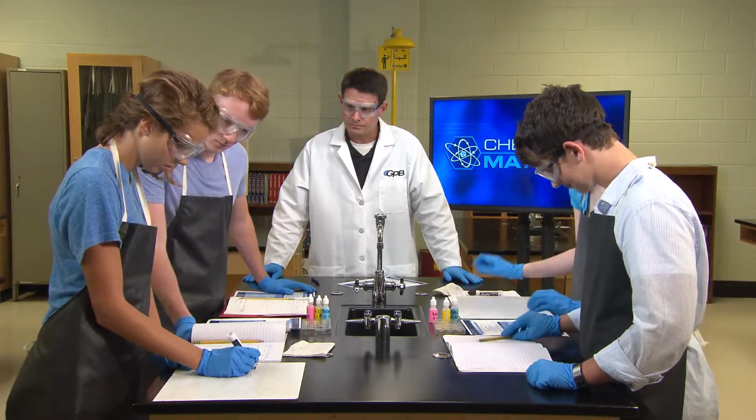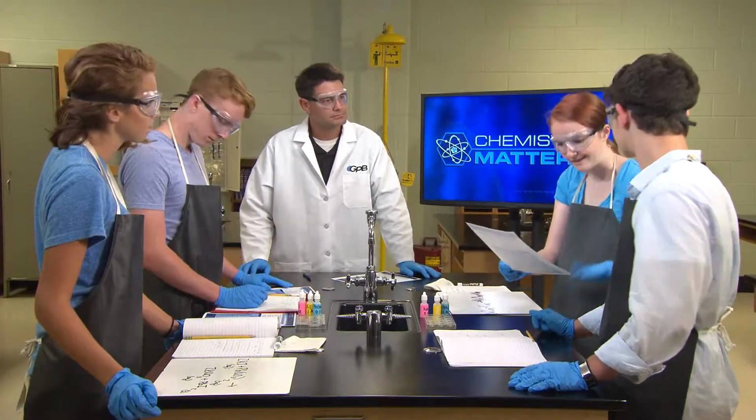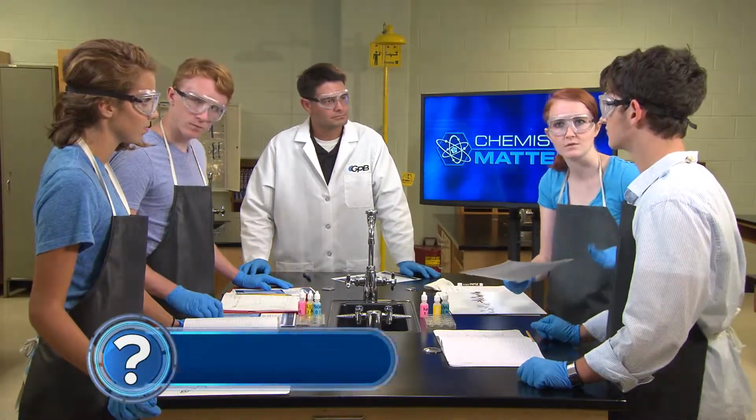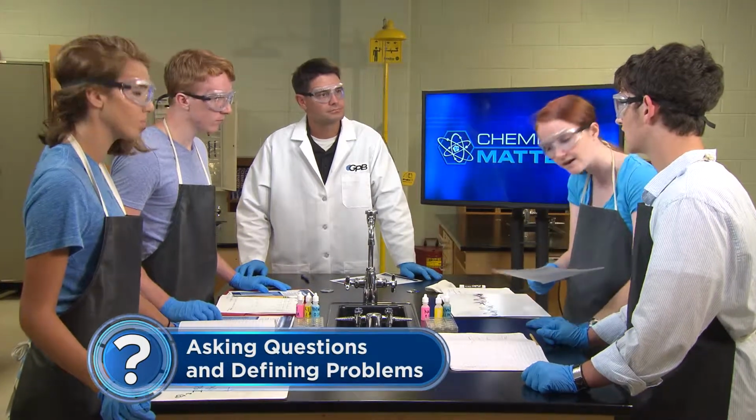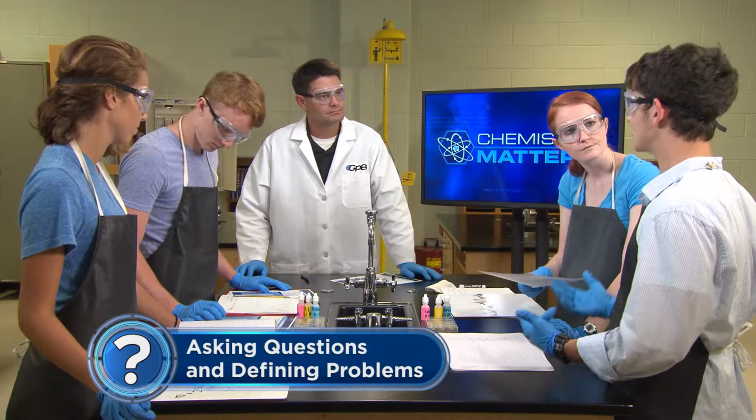Okay, so potassium nitrate is soluble, and lead-2 iodide isn't. So is that what the yellow stuff was? The lead-2 iodide? I believe so. Let's look up the products of one of the mixtures that didn't react.